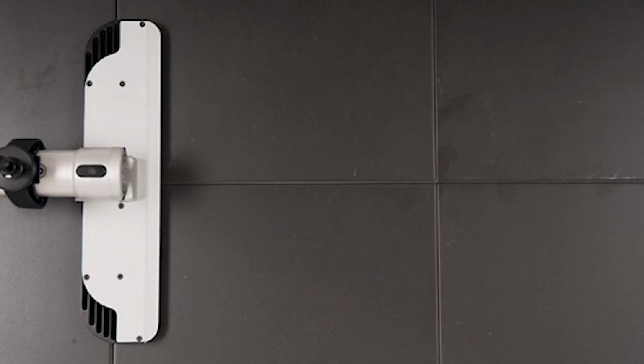So the simplest of those techniques is probably oblique illumination. So this involves lighting our evidence from a low oblique angle along the surface. So this is really, really effective for 3D evidence types. So anything that's impression-like in its appearance. So whether that's deposited into or on top of a surface. We can use a light source like the 82L Pro to achieve oblique illumination.